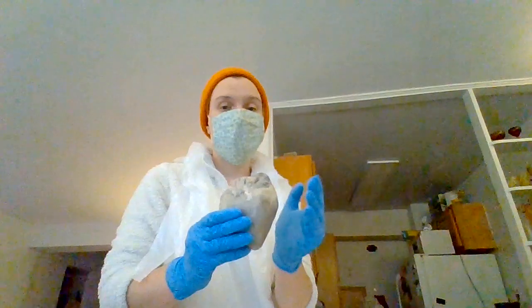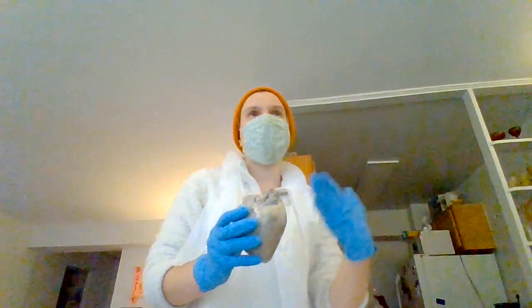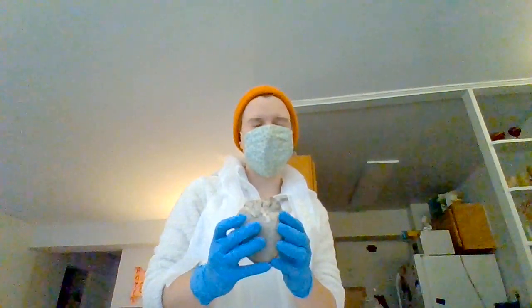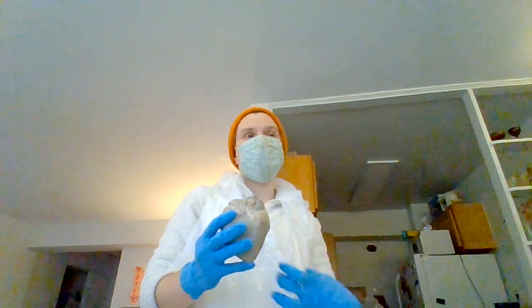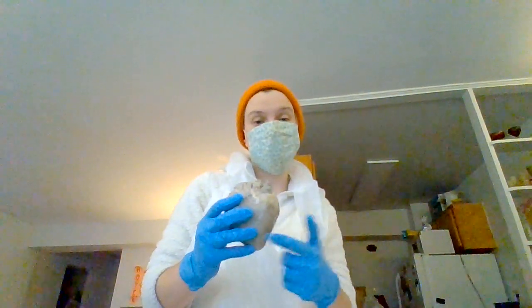So, when we're looking at the heart from an anterior view, the right and left sides are very important, and they correspond with your right and your left. So when you're looking at it, it would be the opposite of what you think. This side is going to be the right, this side is going to be the left. Each side is going to have an atrium and a ventricle. The atrium takes in the incoming blood, and the ventricle sends out the outgoing blood. So this is going to be right atrium, right ventricle, left atrium, left ventricle.